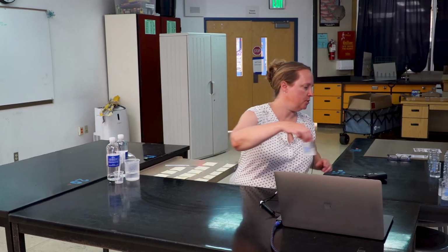So I would just counsel students that if they see that it's cloudy, and even letting it sit for a while none of it settles, you don't see a clear distinction of settling out at the bottom and then clear liquid above it, I would say slightly soluble. If it's very clearly not soluble, like this one, there really is no reason to do a conductivity test, because the conductivity test is meant to be only for the substances that did dissolve. We just went ahead and did all 16 substances anyway. That could be a conversation that you have with your students.